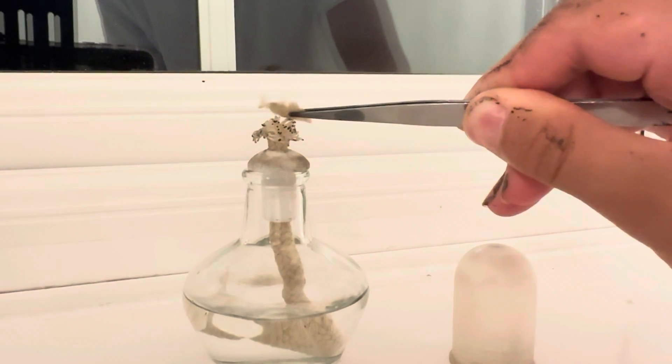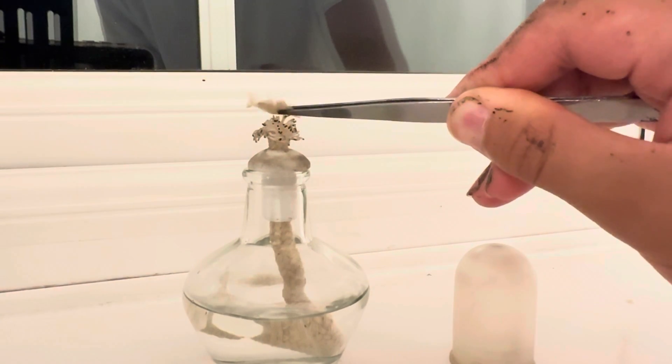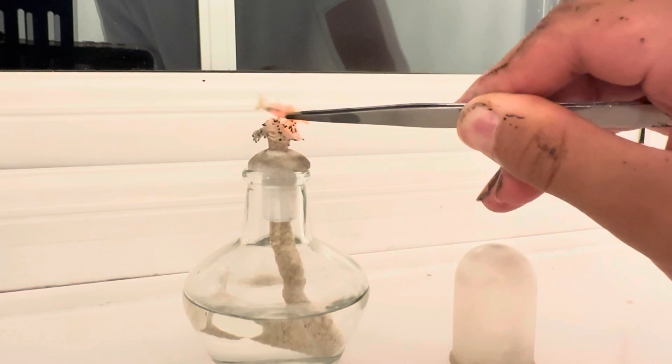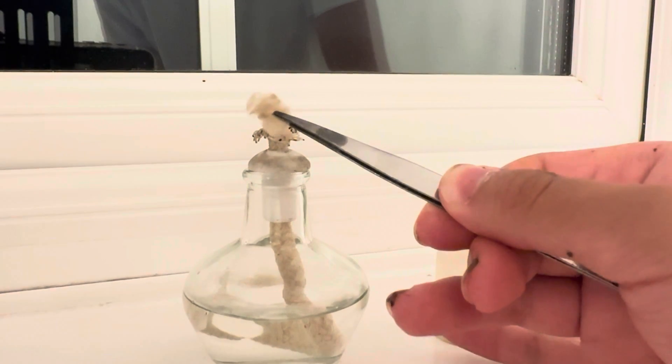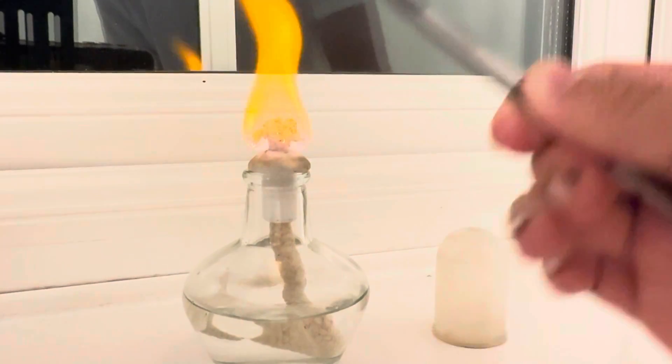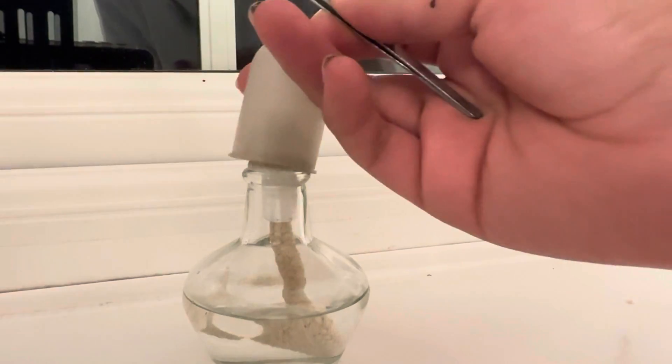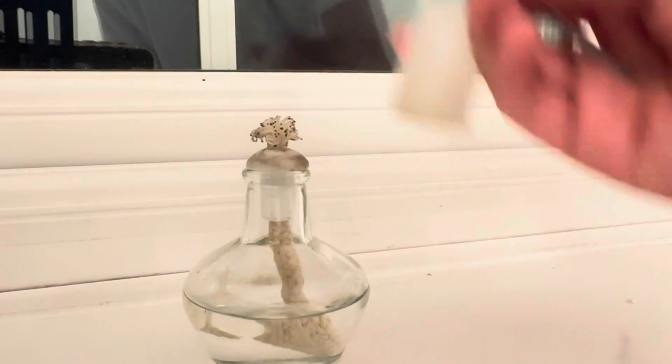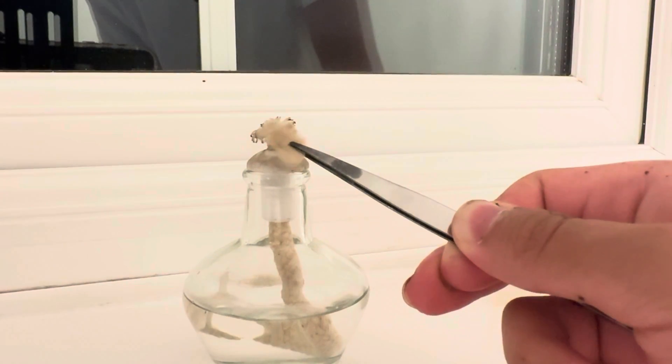Now we can try again. You can see here, if we watch closely, the wool immediately starts to glow orange hot. This demonstrates the catalytic combustion of methanol.